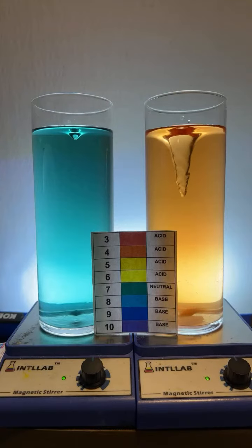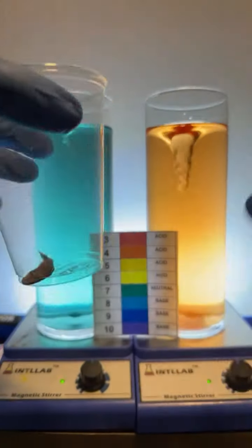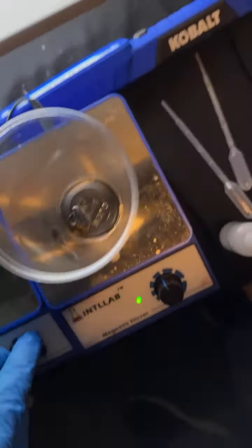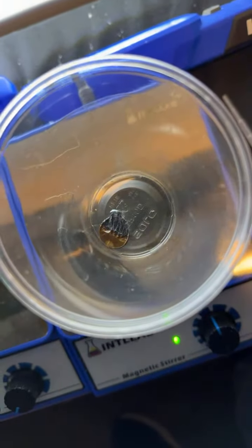Okay. So I'm going to take this penny. I'm going to pop it in this cup. I'm going to take this off here, and we're going to try it a second. I don't know if this is going to work, but somebody's been very patiently asking me to try this, so we're going to try it, all right? I'll turn this off here. Yeah, it's not looking real good, but I'm doing the best I can here.